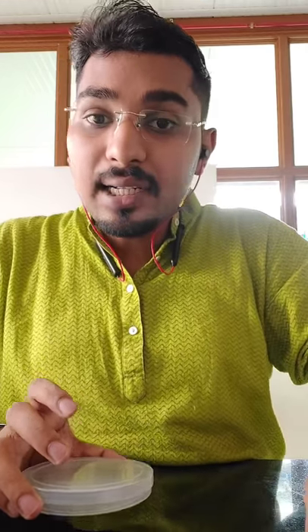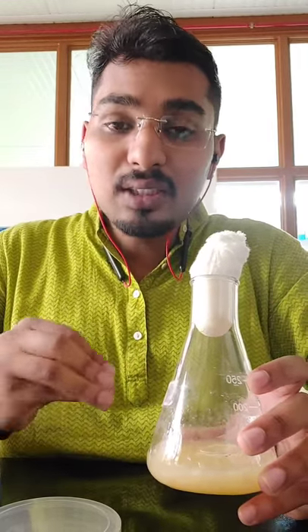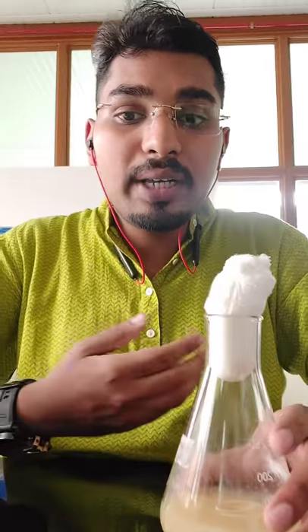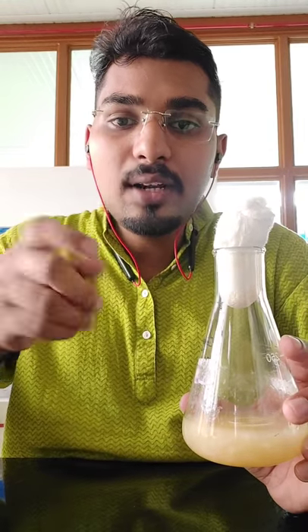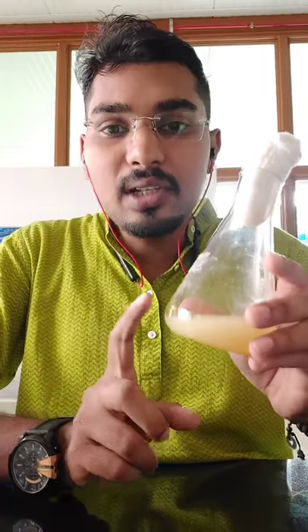One special characteristic feature of fungi is that they produce enzymes and metabolites even outside the body. If you want the compounds produced outside the hyphae — extracellular products — you centrifuge this: all the filaments and hyphae will form a pellet, you wash that pellet once or twice with distilled water, and collect the supernatant. You can evaporate the supernatant or use it directly for experiments. If you want both intracellular and extracellular products, you have to do two sets of experiments.